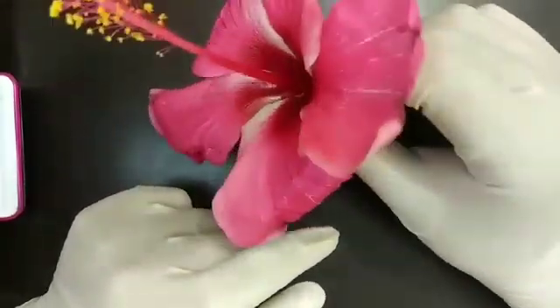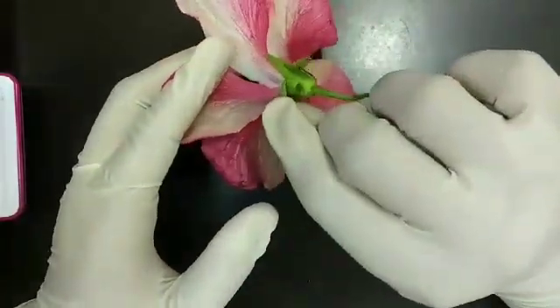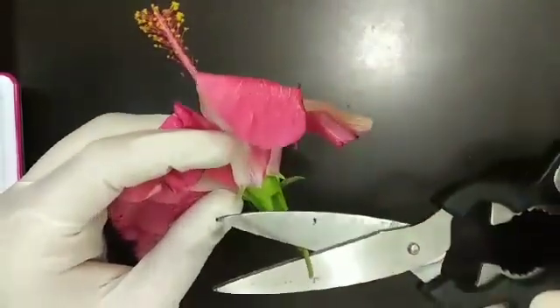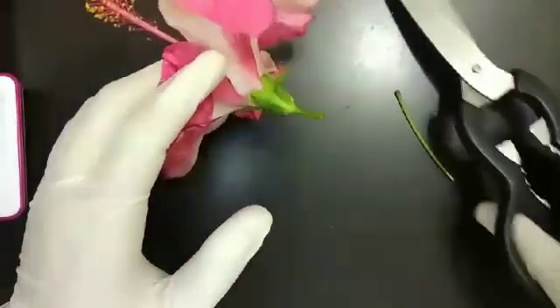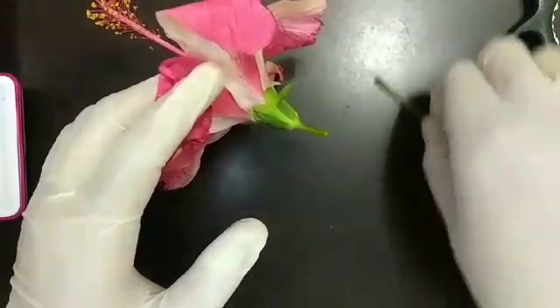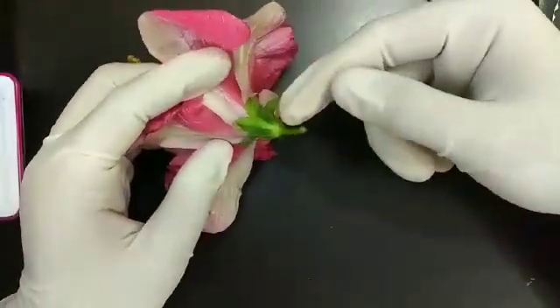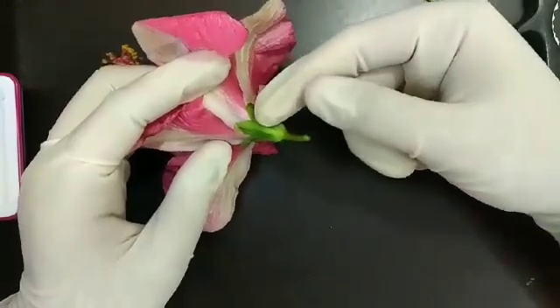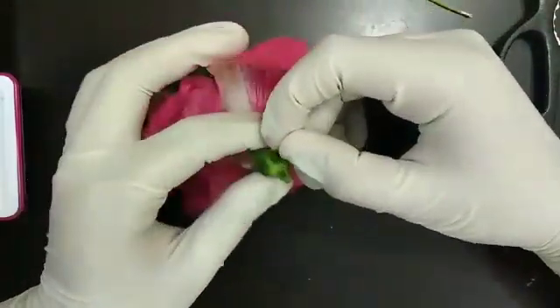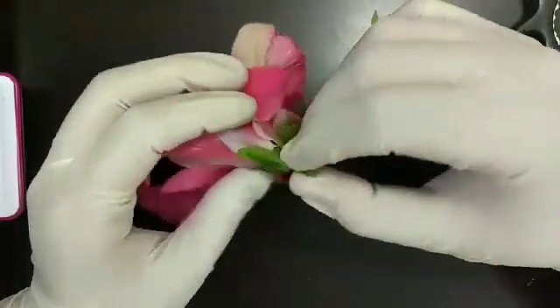So let us start. First is the removal of the sepals from the flower. We are going to remove the sepals from the flower — be very careful while doing this.